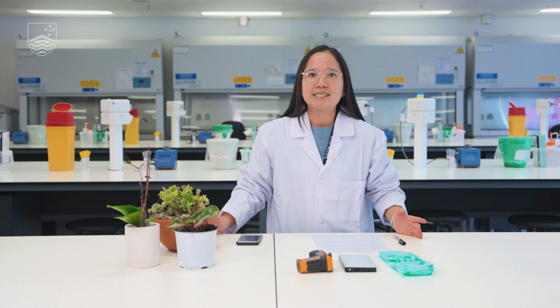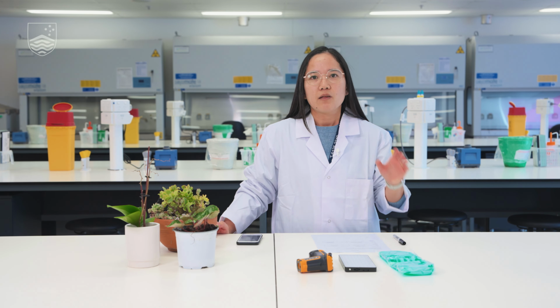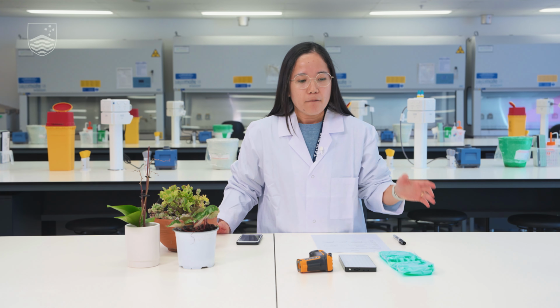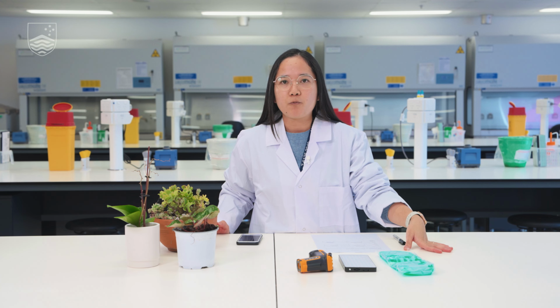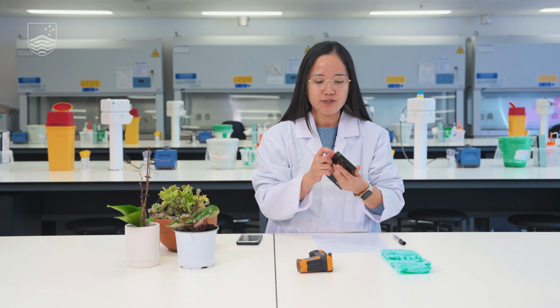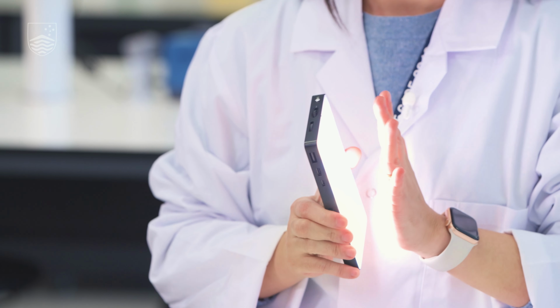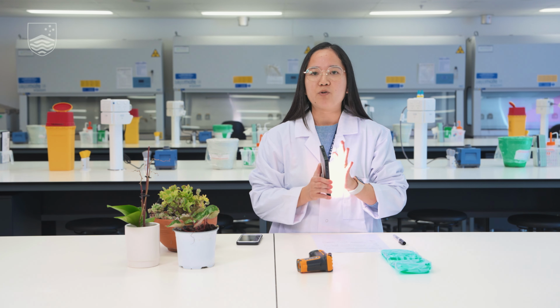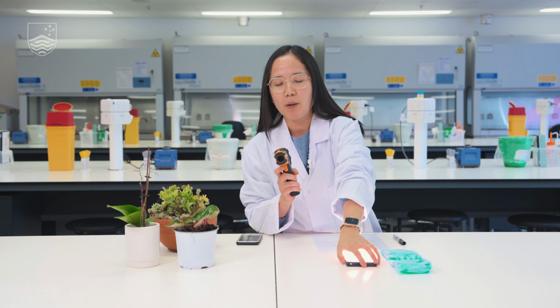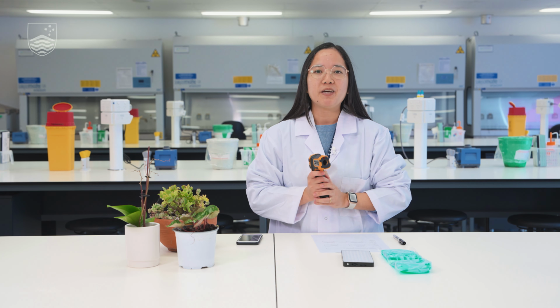So today we have here a setup where we can see simply how we can test those effects of extreme weather events on plants. To facilitate the different weather conditions, we have here an ice pack. So this will simulate the cold temperature. We have here a light source. This light source actually gives off a bit of heat, and so that will simulate the heat temperature. And then we have here a portable thermosensor or thermogun where we can get a measurement of that temperature.